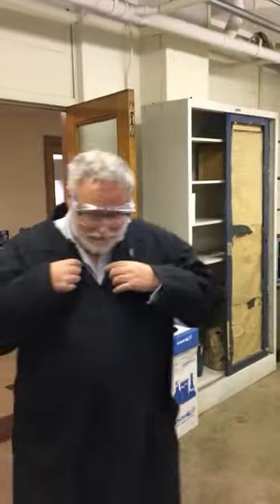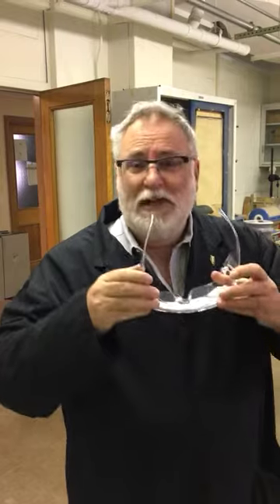Okay, so I'm appropriately attired. I've got my lab coat on, it's buttoned. I don't have long hair, I'm not a bloody hippie, but if I did, it would be tucked away. I put my safety glasses on immediately as I walked in. If I didn't, and you get about this far, you're going to get poked in the eye. Right? That way you will remember, but more importantly, you'll keep your eyesight.